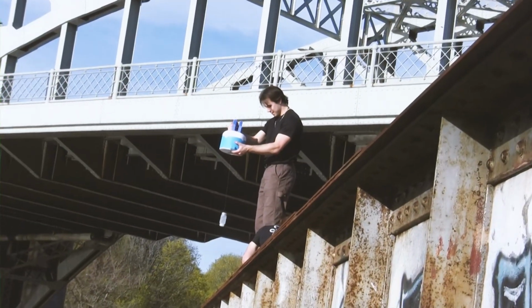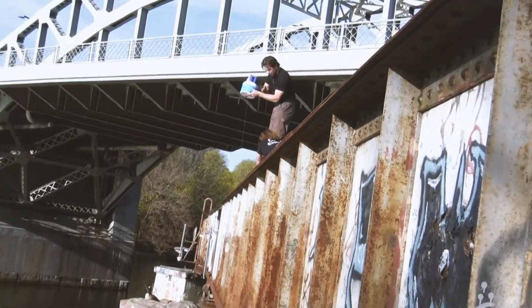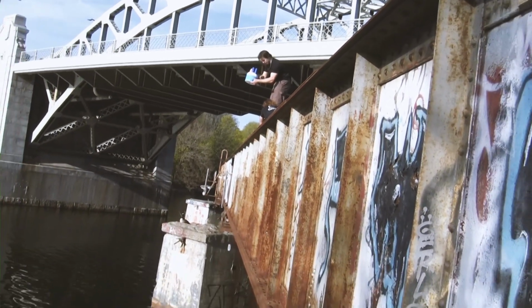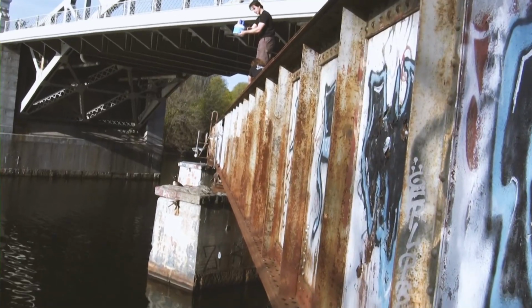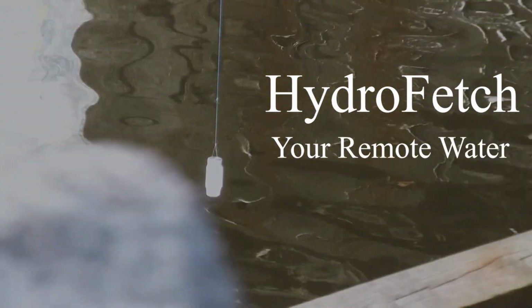Ultimately, this device is able to collect up to 8 samples remotely within more than a 1.5 kilometer range from the controller. Its capable mission time exceeding an hour further reassures its multi-sampling capabilities. HydroFetch, your remote water sampling solution.